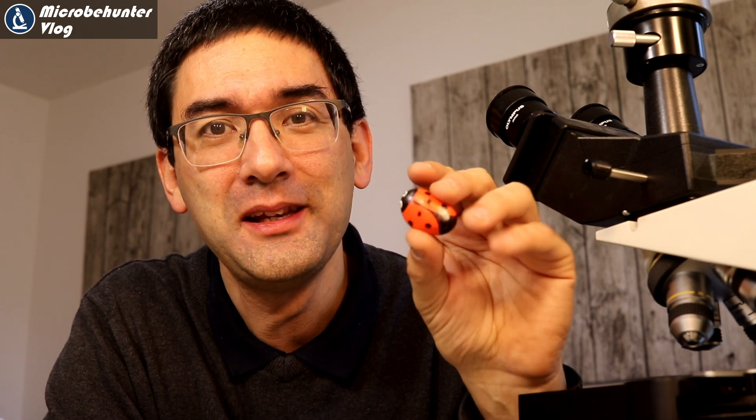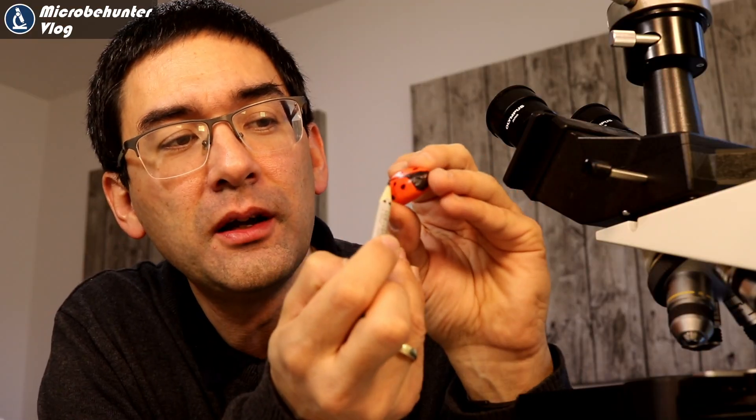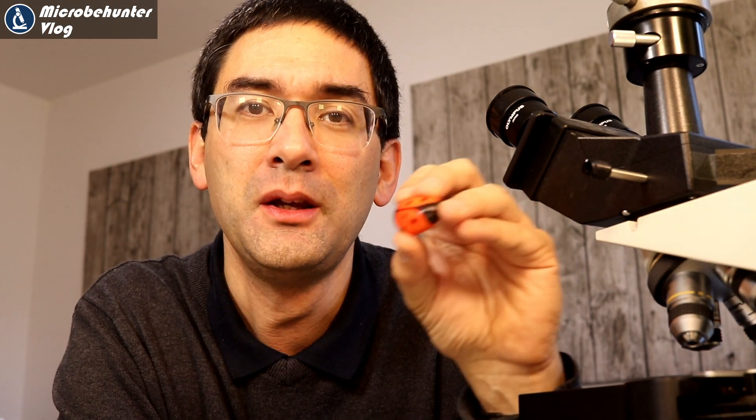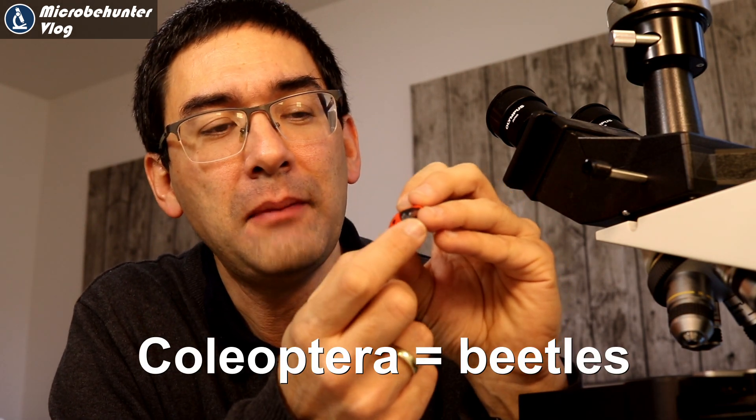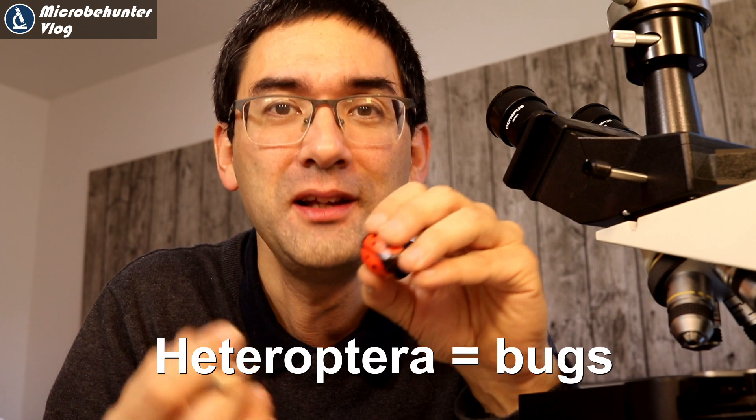This ladybug is an example of a beetle. Looking at the wing structure: the first pair of wings — the elytra — is hardened all the way through. You see it's red with black dots, and the entire wing is completely hard. If it's hardened all the way through, you know it must be a beetle — the correct name being Coleoptera. Bugs are different: the back part of the front wing is very thin, not hard, almost like a membrane, only the front part being hard. This is referred to as Heteroptera — 'hetero' being Greek for 'different' and 'ptera' meaning wings — because the first pair of wings has a front and a back part with different consistency.